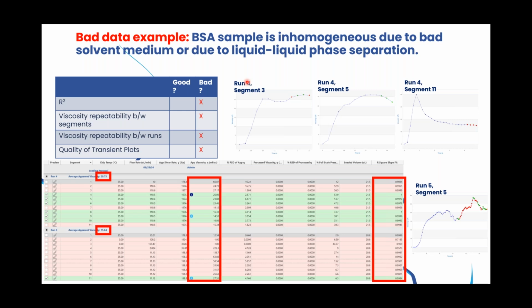But for this final slide here, we want to show what happens when you don't prepare the sample well, or when your sample is undergoing liquid-liquid phase separation. By not prepared well, what I mean is that the solvent is not adequately dissolving your protein. So what happens is that you can see some or all of these issues we show here. One of these is that the R squared is bad. Also, your viscosity is not repeatable between segments or runs. Another thing you may see is the quality of the viscosity versus time plots is not good. So these are some examples here.